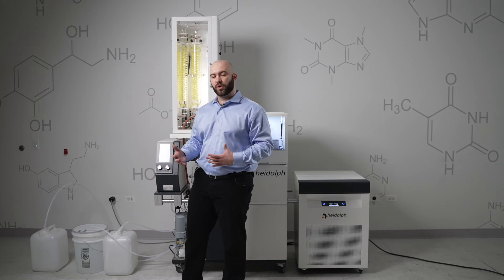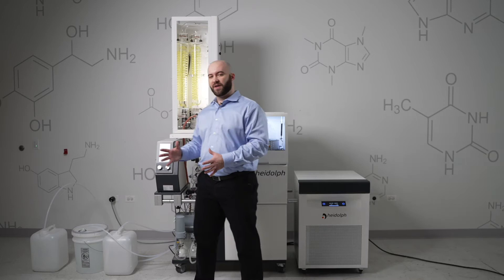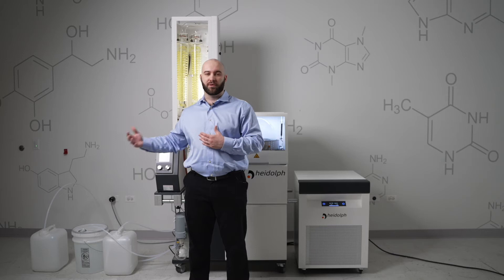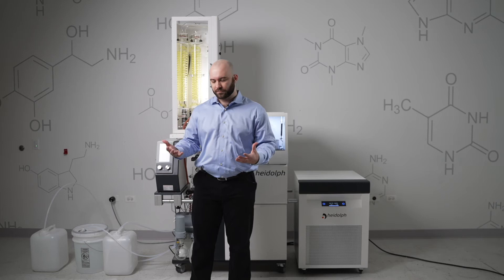Your second carboy or drum will be for your condensate, which is your condensed solvent. And your third carboy is going to be that residual product. You're going to want to find containers that can basically contain the amount of products that will be pushed through them all — your largest most likely being your initial product, second largest being your solvent retrieval or condensate, and your third being the residual product.